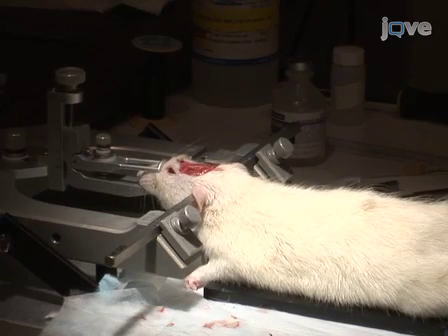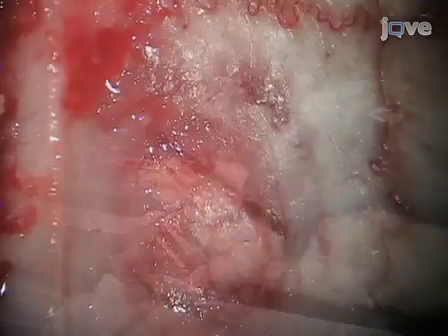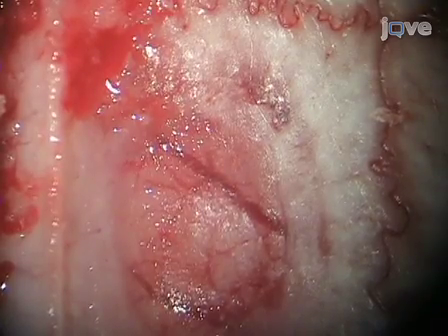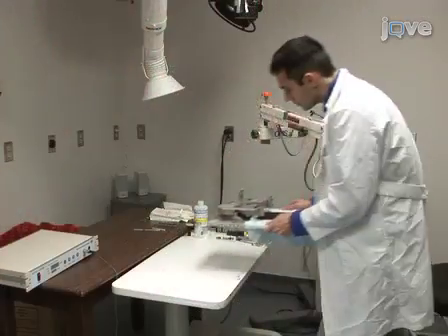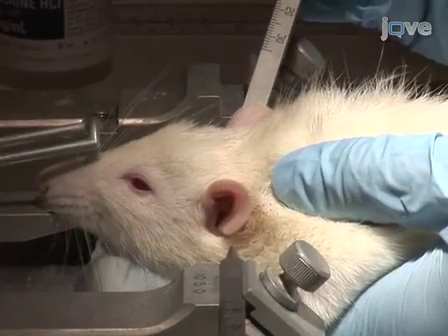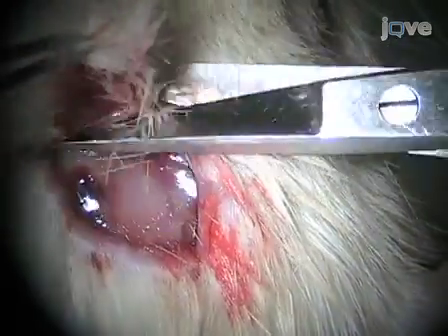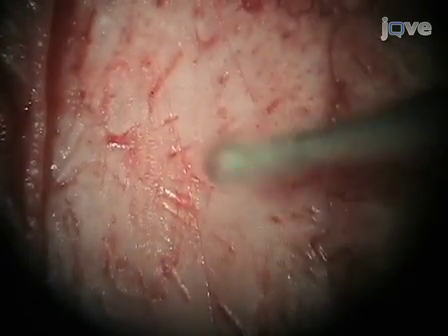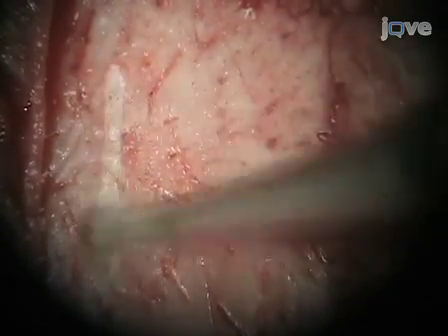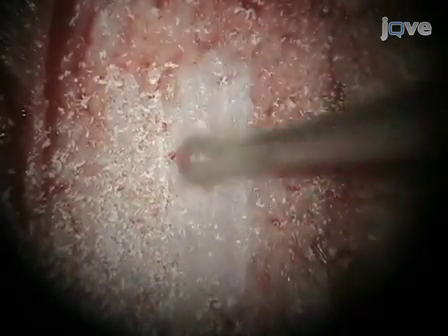Before the imaging system can be used, animals must go through a surgical preparation to create a window over the tissue of interest. This involves thinning the skull over the desired brain region. Begin by placing the urethane anesthetized animal into a stereotactic holder. Use a dissection microscope to remove the skin and tissue surrounding the skull. Now use a dental drill to thin the skull over the desired region until it is transparent. Depending on the experiment, the thinned skull can either be removed or simply left alone.